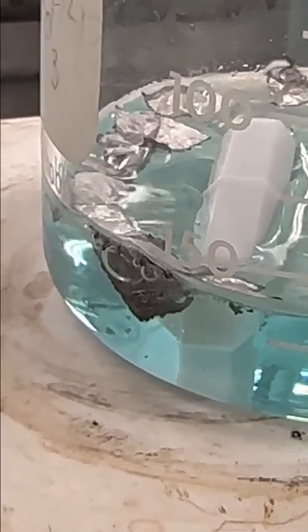All right, so if we're looking right at this piece of aluminum foil, you can see that there is a spongy red color that's forming on the foil. And you can see lots of bubbles being evolved here as this reaction is taking place. This is the gas that's evolving from the reaction. And I am trapping it up here in the fume hood because it's unpleasant.